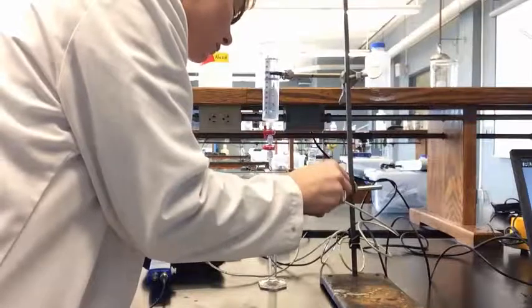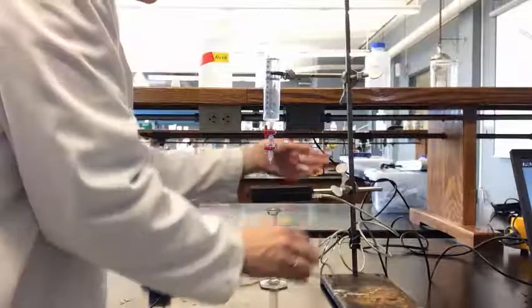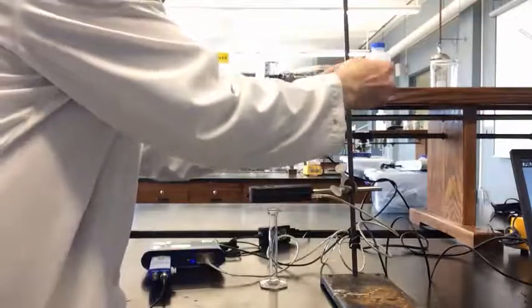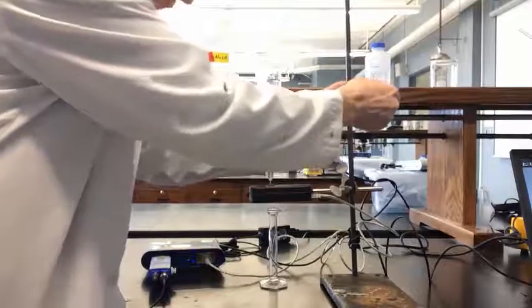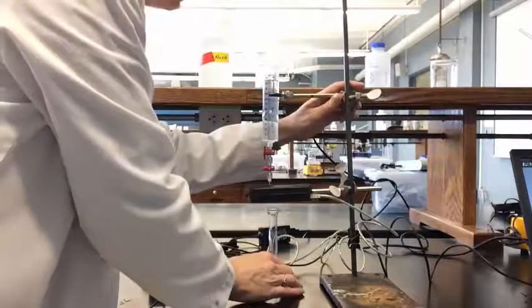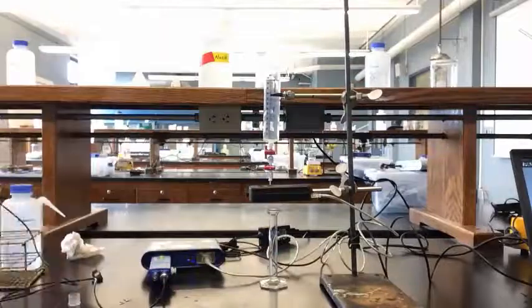Adjust the syringe height until the tip is just above the drop counter. Replace the graduated cylinder with a waste beaker.